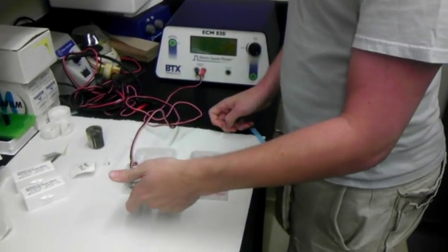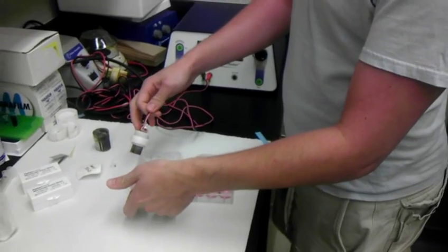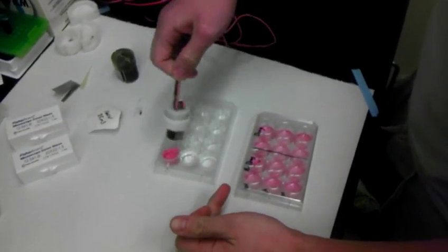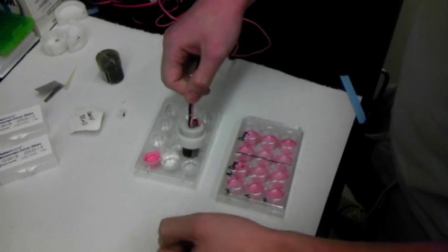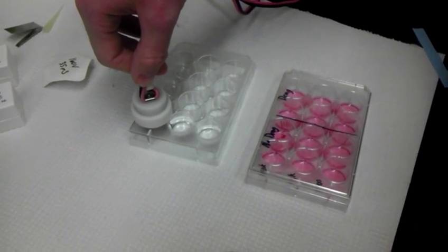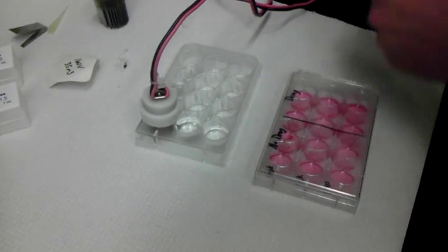So we have prepared alcohol, water, and DMEM without FBS in this well to clean the electrode. I have first soaked the electrode in alcohol first, water, and then I've let it rest in the DMEM for a little while to calibrate.